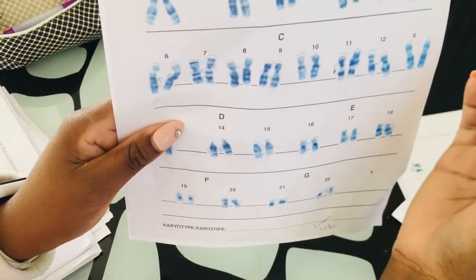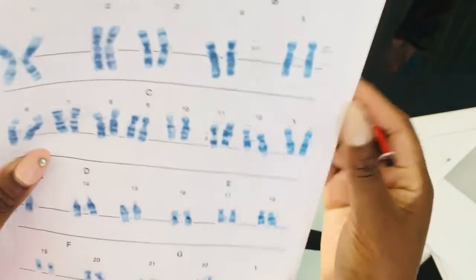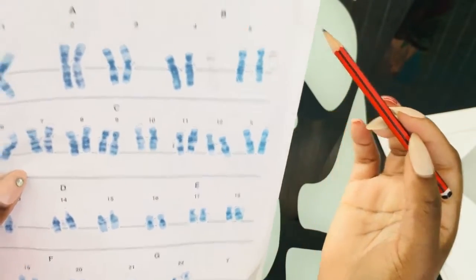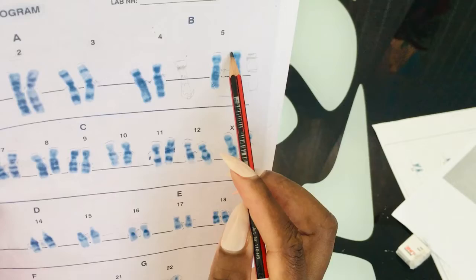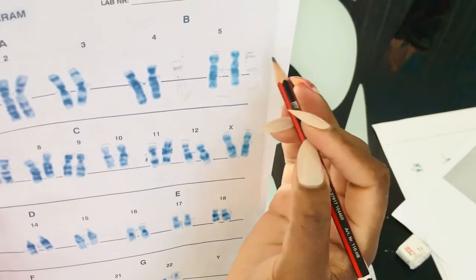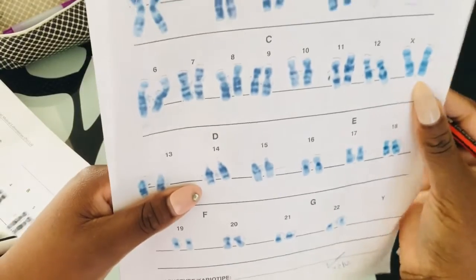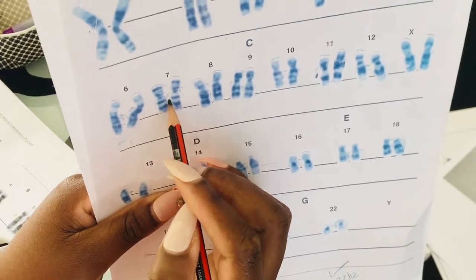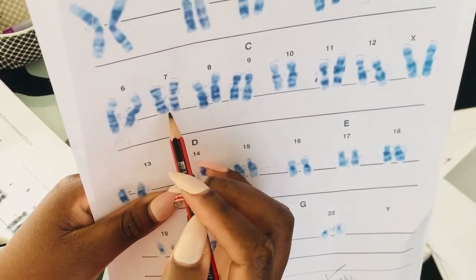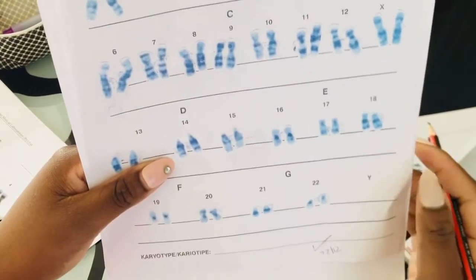Your chromosome 5, can you see, will also have a dark band. I'm just worried if you can see. Yes, your chromosome 5 will also have a dark band, but it won't be at the edges like your chromosome 7. There will be a little bit of space here, and then you have this dark band. But for your chromosome 7, the dark prominent band will be right at the edges. And you also get another 2 prominent dark bands on your Q arm of the chromosome.